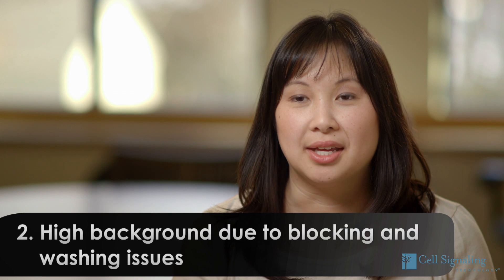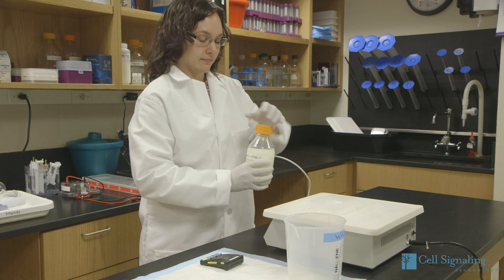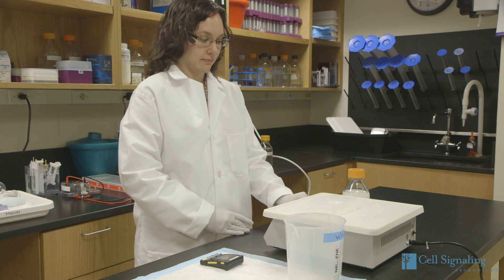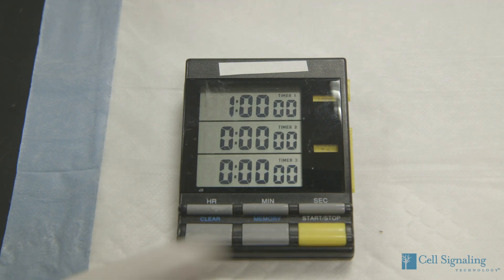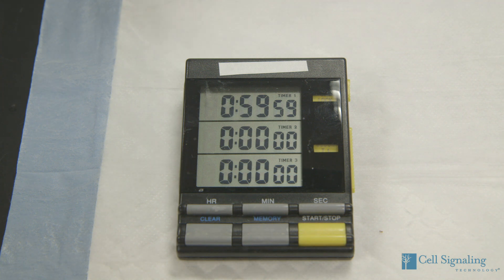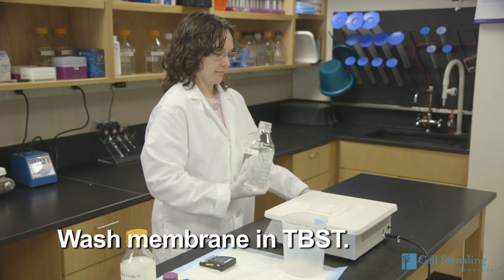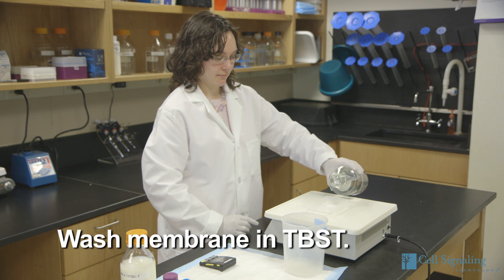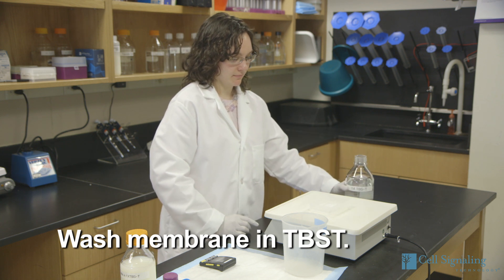Insufficient membrane blocking and inadequate washing can result in high background. Blocking for less than one hour or using another blocking buffer can result in nonspecific binding of primary and secondary antibody. For wash steps, using TBST buffer that contains the mild detergent Tween-20 helps remove nonspecifically bound proteins.